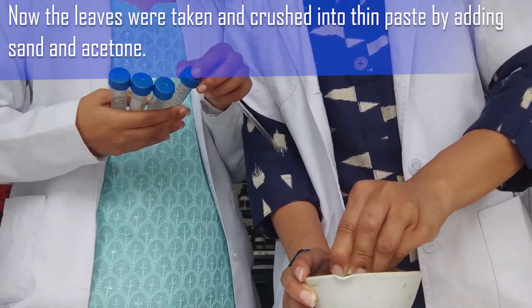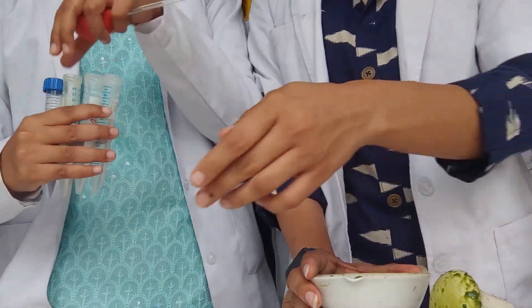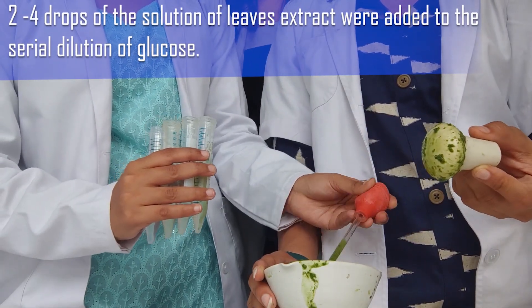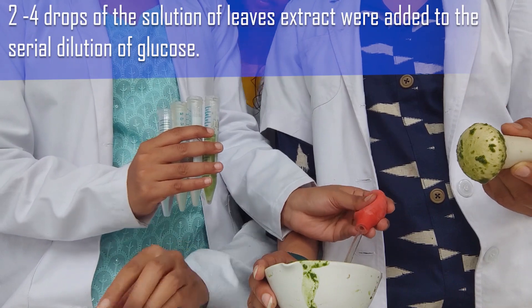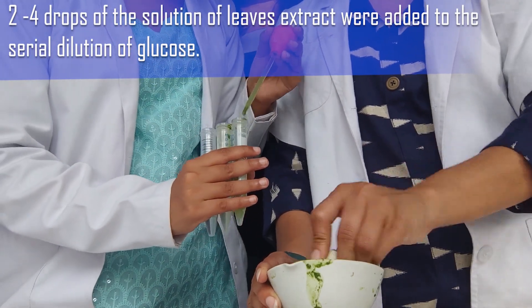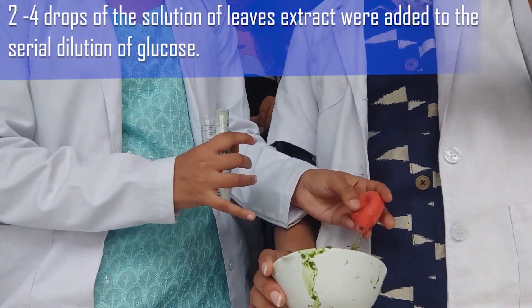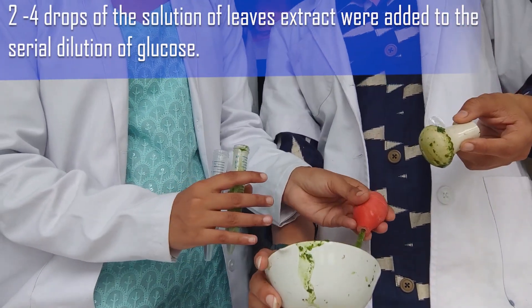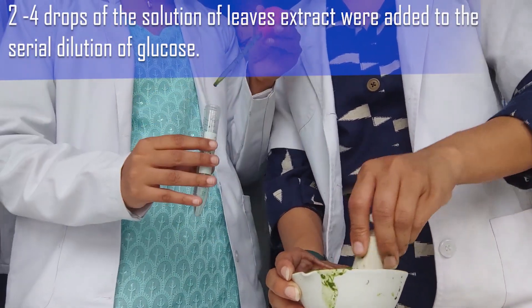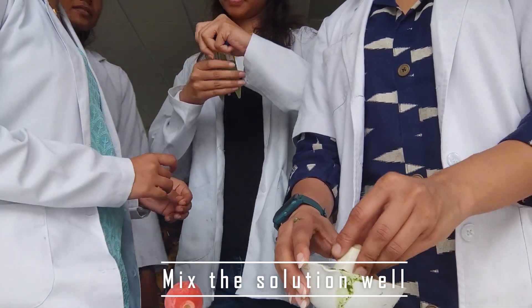Now bring those four tubes in which we have done the serial dilution. Add two to four drops of leaf extract solution to each of the serial dilution glucose tubes. Remember not to add too much or too little extract. This is what we are doing — differential centrifugation. Here we have our four solutions; mix them well.